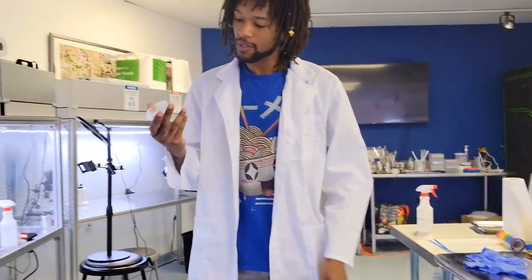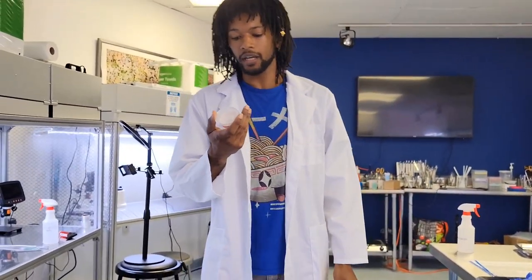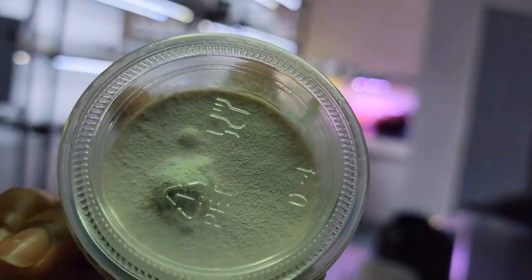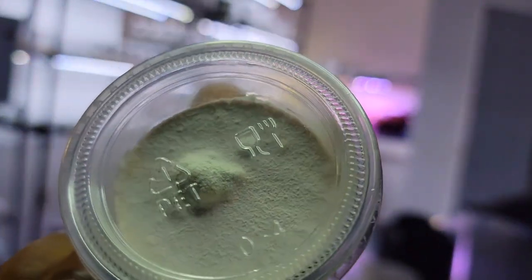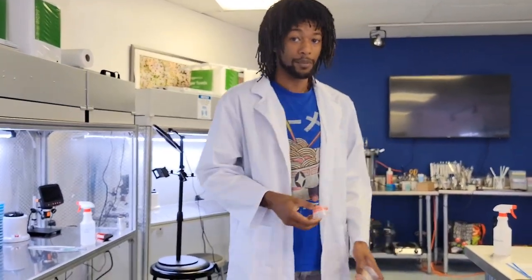We've got some fresh agar plates and a bunch of specimens today. We've got a local Ganoderma reishi that was growing out of the sidewalk just a few blocks from here. I cultured this back about a year ago and played with it a little bit but didn't get too far into it, so we're going to start that back up today.